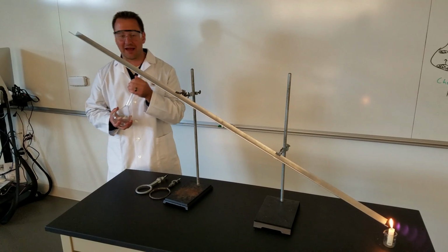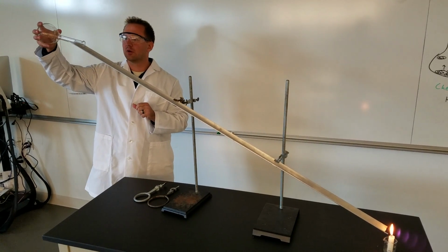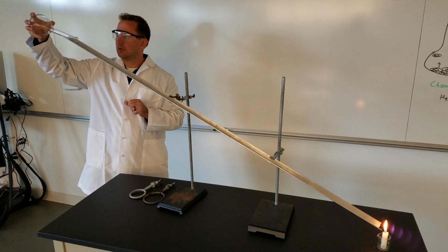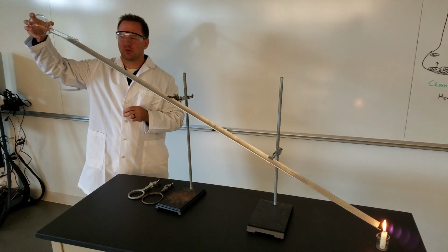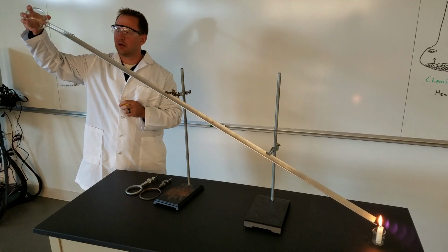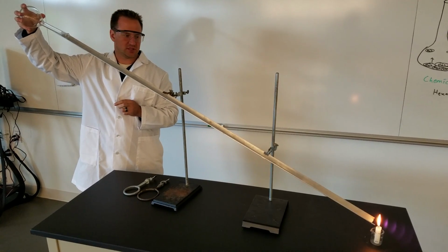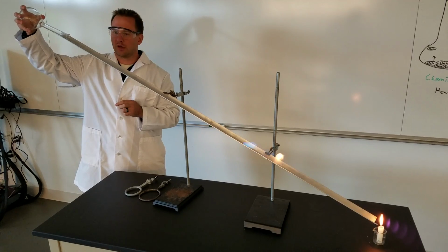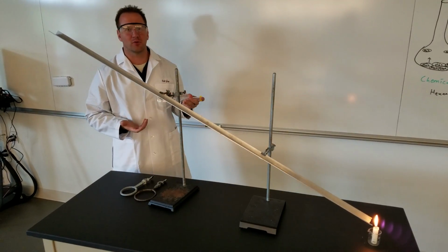It's a little scary. I have to be quick, so I'm going to pour it. I just want to be very careful when I do it. Okay? I don't know. Maybe I should do a different demo. I don't know. See, I'll get there. It just takes me a minute emotionally and mentally to prepare. Whoa. But I didn't actually pour any liquid.